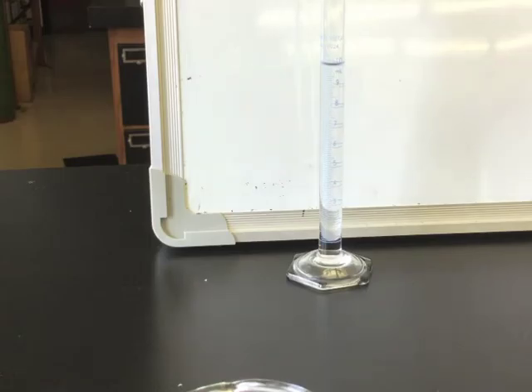You may notice drips on the outside of your graduated cylinder or feel that it is wet when you're moving it around. Will this add to the mass that is perceived on the analytical balance? Will this change the volume that you measure? Does it change the actual volume of the unknown liquid inside of the graduated cylinder?